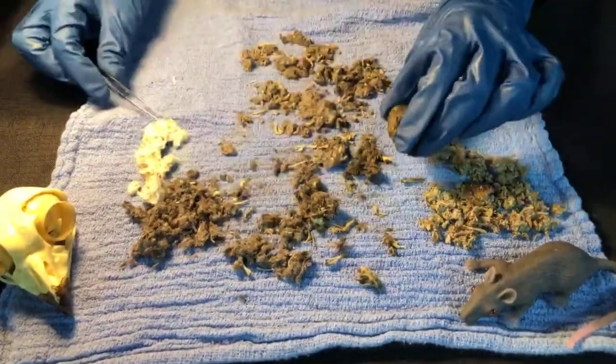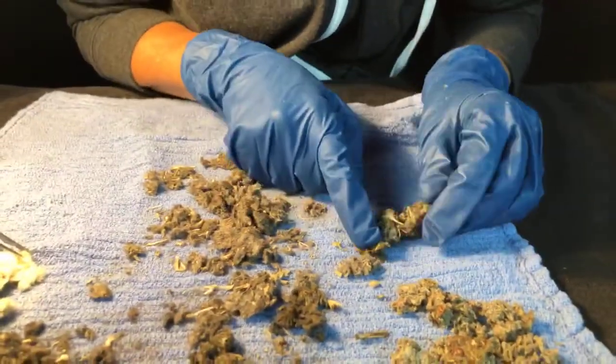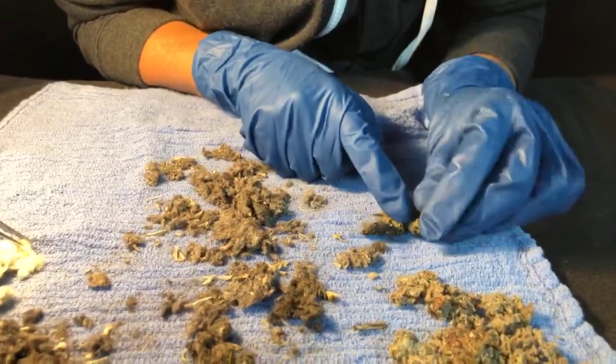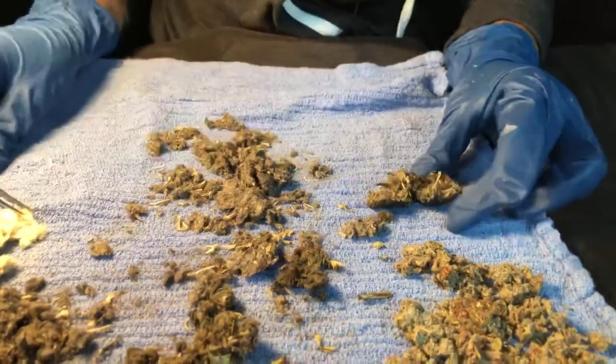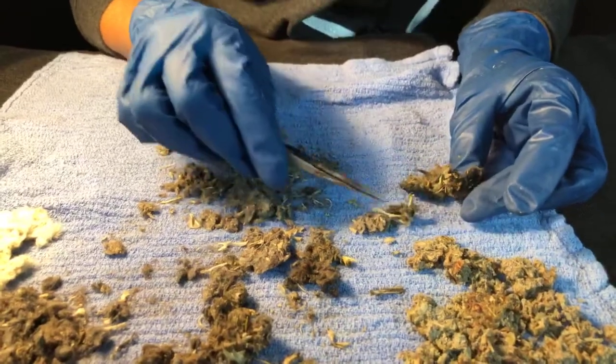But you can see, just by these 3 pellets, that's a lot of little animals there. It is. And if you had the time and some super glue, you probably could put this all back together. I've always wanted to do a fully articulated skeleton of a mouse coming out of an owl pellet. Yeah, that's one of my goals.